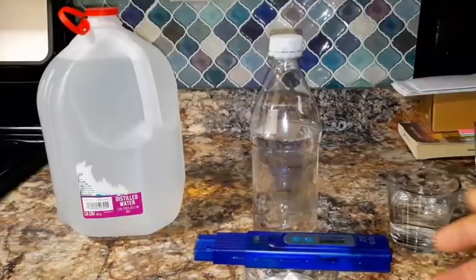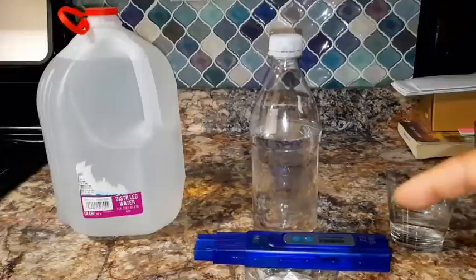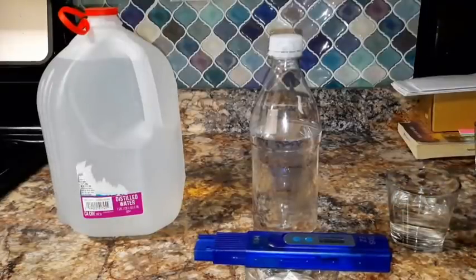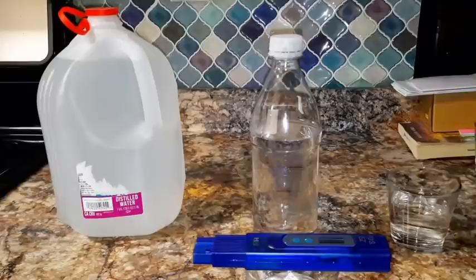And if you try to do the same test, I believe, with a Berkey, I haven't done this test with the Berkey system yet, but if you try, you're going to get ppms, because that Berkey system does have a filter that's ceramic. And a lot of those little bits sometimes come off. They're not bad for you, but they will be picked up by this. However, I do stand by the Berkey. I think that the water it produces is very good, and whatever ppms are in there are not harmful to you. At least that's my understanding.